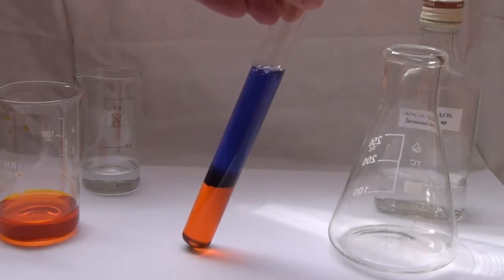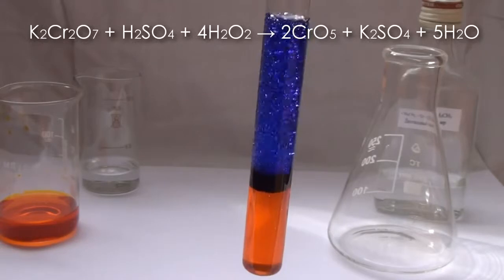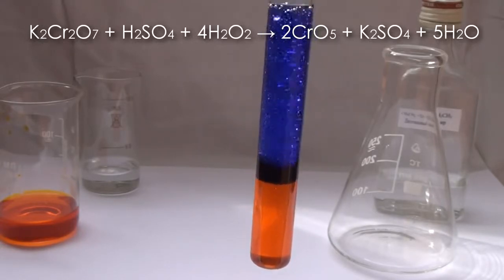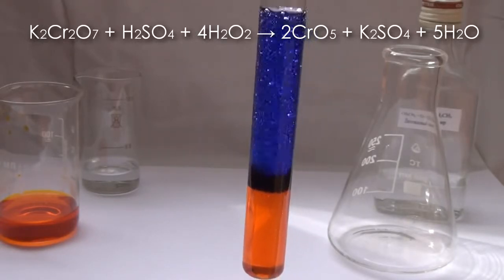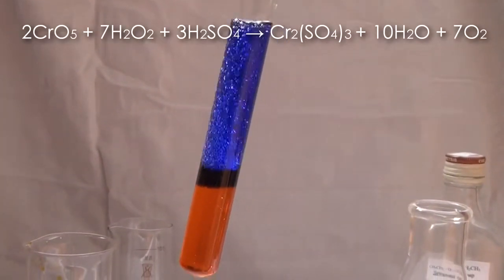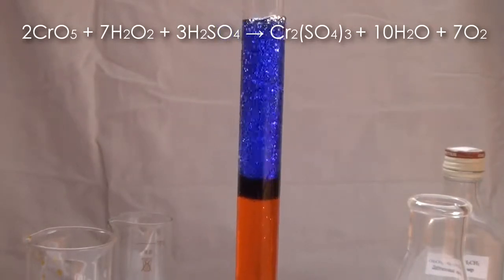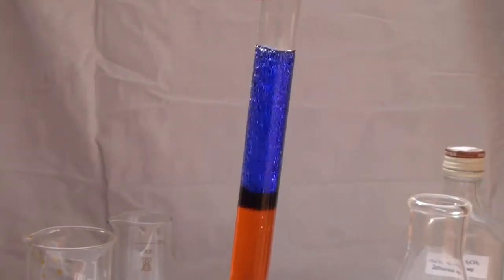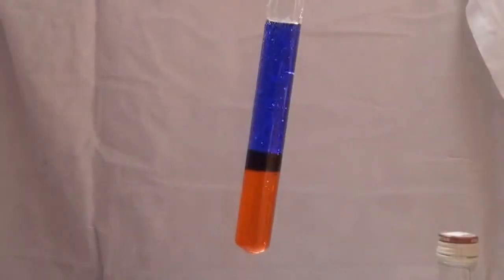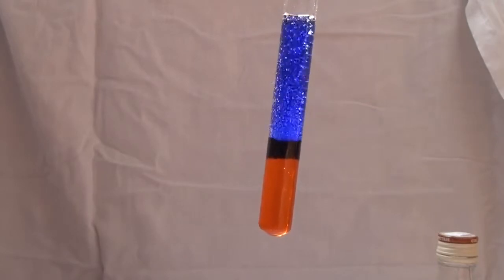When potassium dichromate and hydrogen peroxide react in an acidic environment, an unstable compound is formed — chromium oxide peroxide. That compound decomposes immediately in aqueous solution and gives the middle layer of the liquid a dark color. However, in organic solvents such as diethyl ether, chromium oxide peroxide can be stabilized and exist long enough without decomposition.